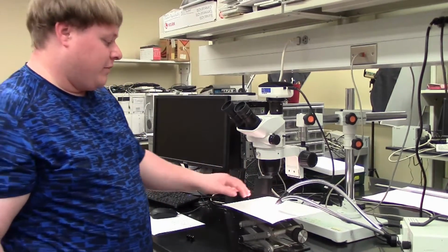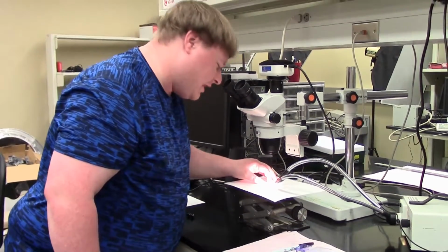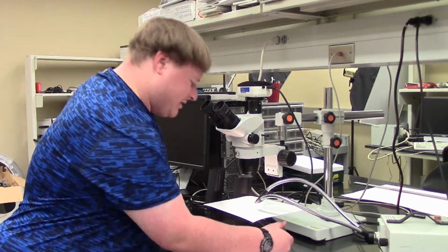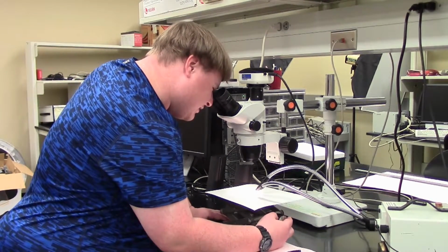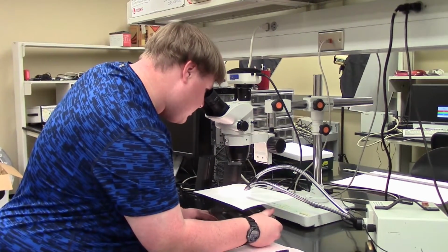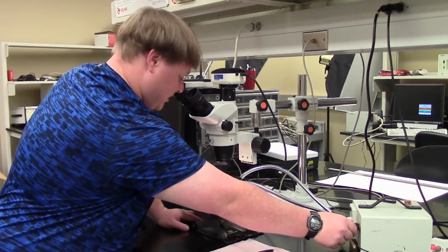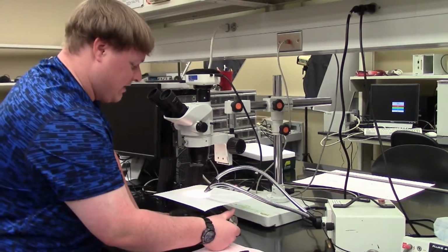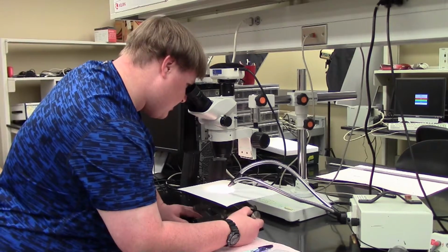Then we put our slide or whatever in place. It doesn't have to be precise, but again, you adjust it. Then from there, use the knob on the motion stand to adjust your focus. If need be, you need to adjust your light, because in this case the calibration slide is kind of difficult to see. So you need every bit of zoom magnification that you can get.